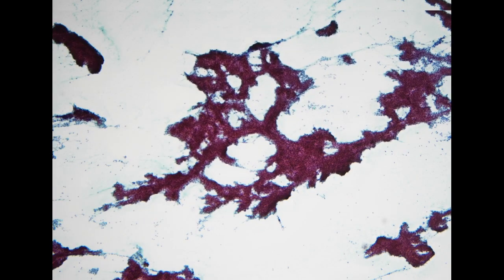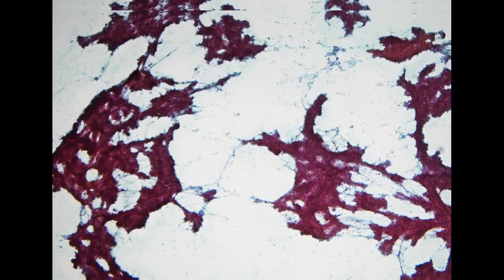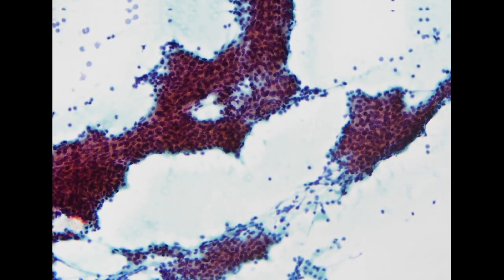So this is the direct smear. Again, you can see these very complex, delicate papillary structures, and the background is very clean, with no colloid at all. This is a typical case of a parathyroid lesion, and based on the clinical information, the most likely diagnosis is secondary hyperplasia. We will use the residual liquid-based cytology specimen to perform GATA3 and parathyroid hormone staining for confirmation that this is of parathyroid origin.